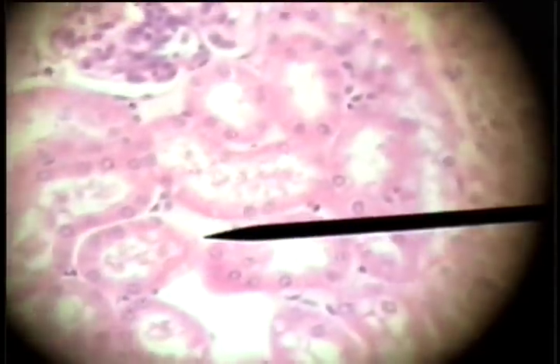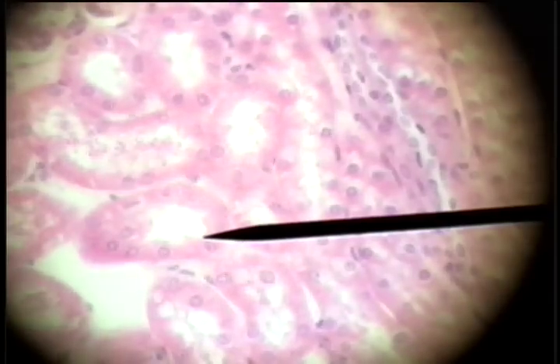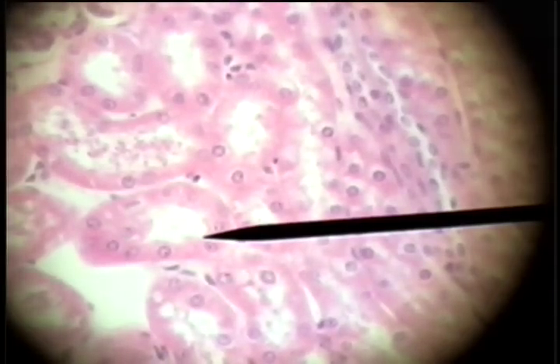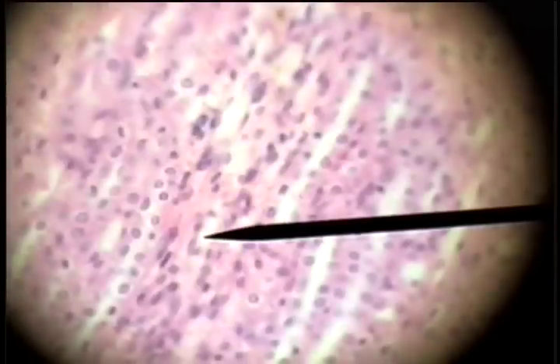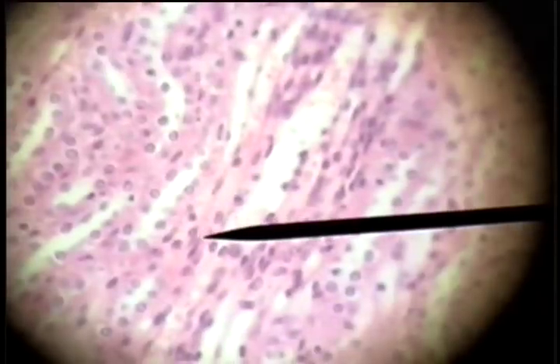There's an oblique cut, so we see the tube as an oval with cuboidal epithelium, and then deeper in the kidney, we see these kidney tubules.